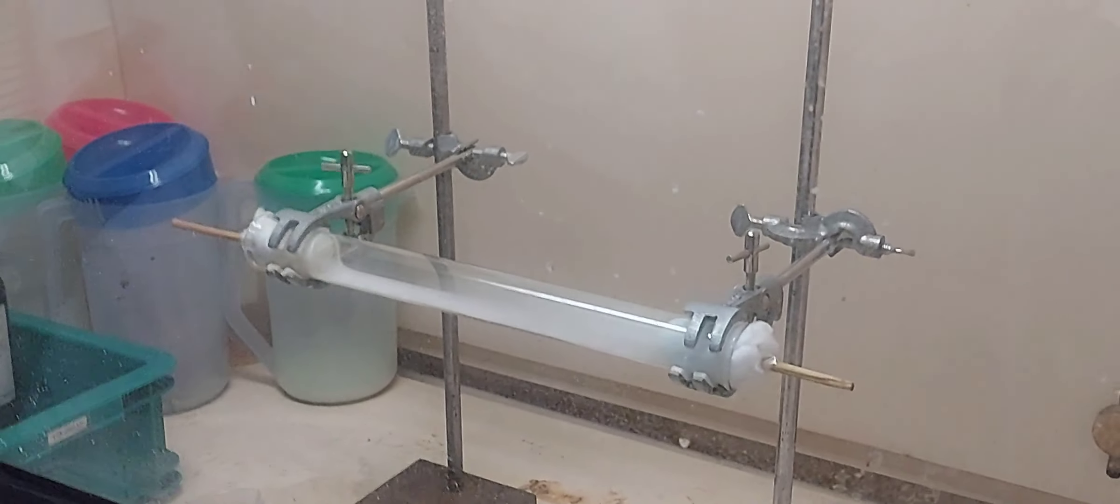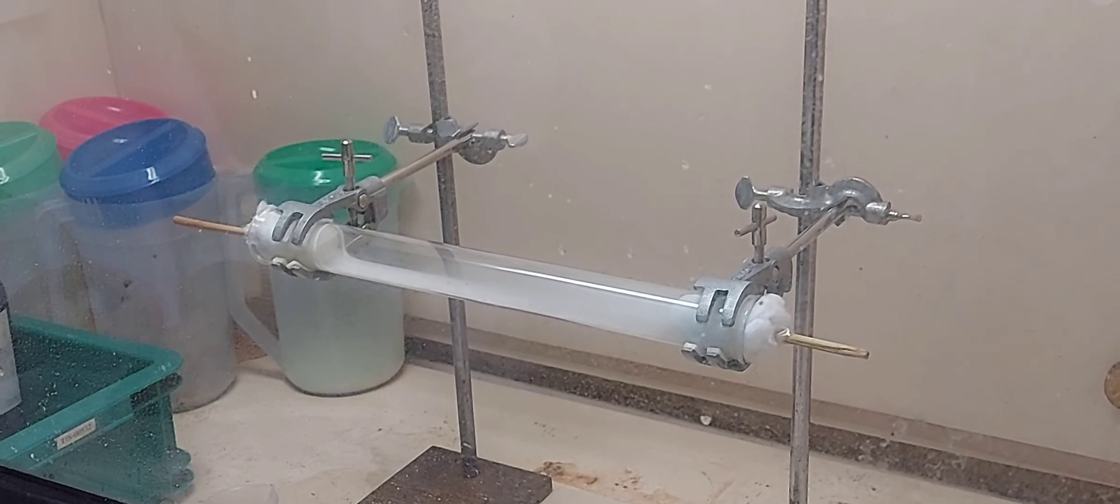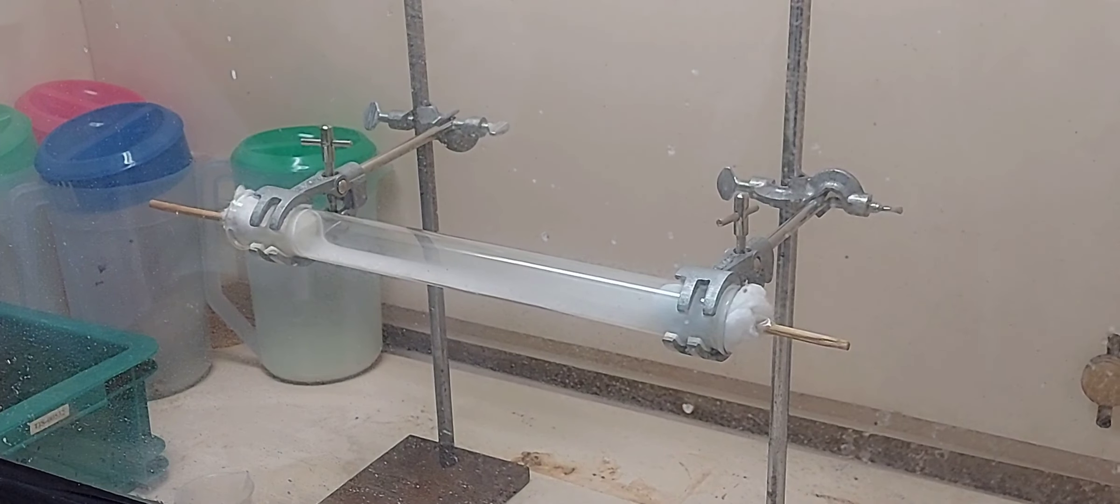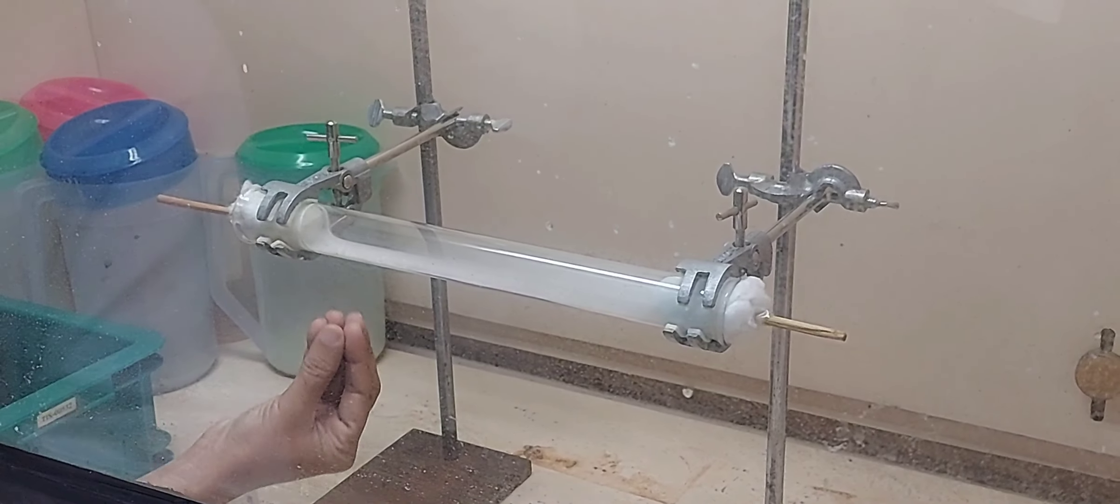And when the two react, you are getting ammonium chloride. You are getting the white fumes. Now slowly you can see it is filling up. But initially it started here.